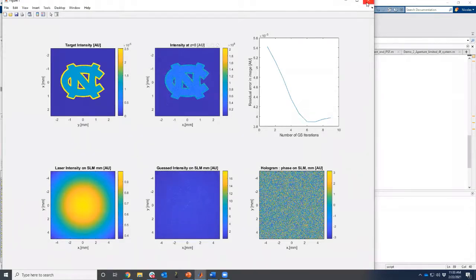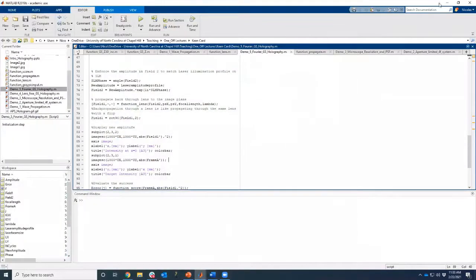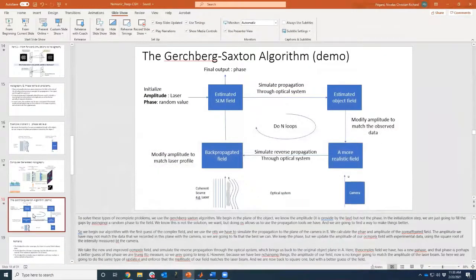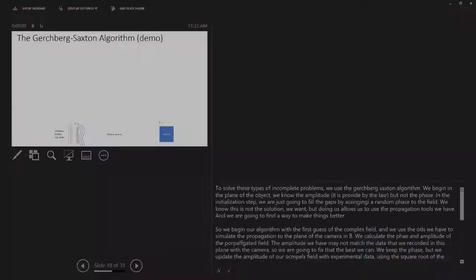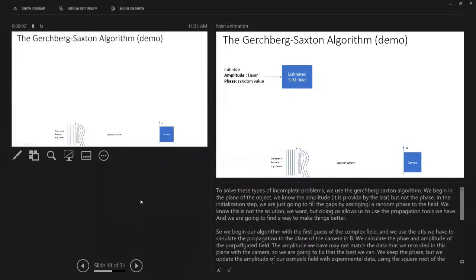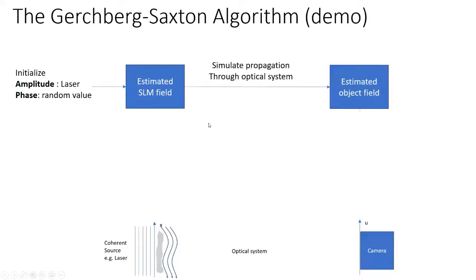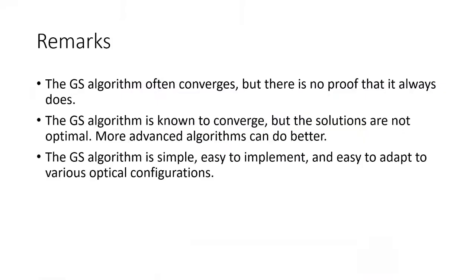So you can play with this algorithm as much as you want. It's meant to be edited, but it's also written in a way that is perhaps as easy to display as possible. So this is the simplest possible algorithm out there. The beauty of it is that it's really easy to implement. It's 4 lines of code, really, if you ignore all the fancy display that takes forever to code with Matlab. But it's perhaps the easiest one that is out there for its simplicity.